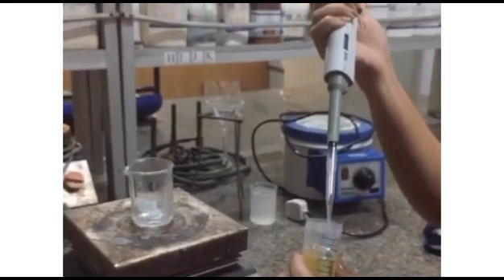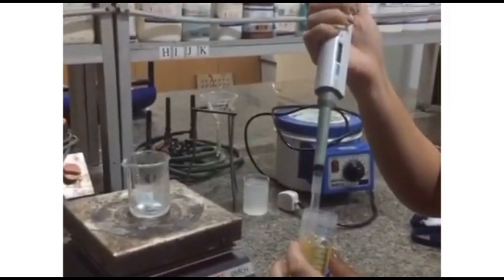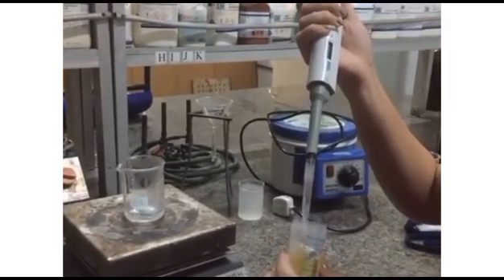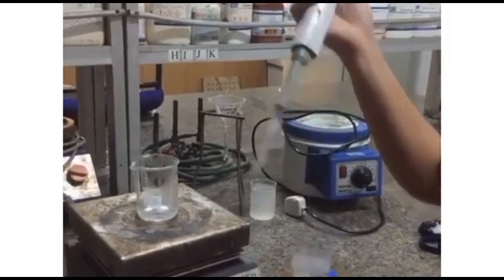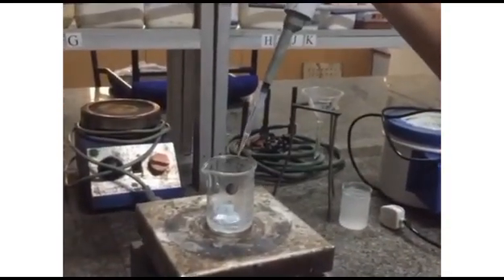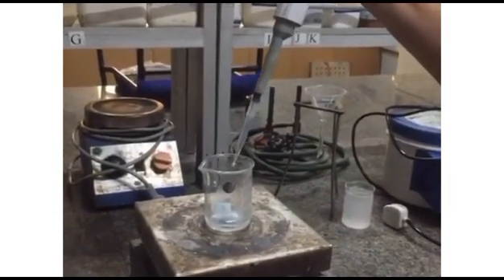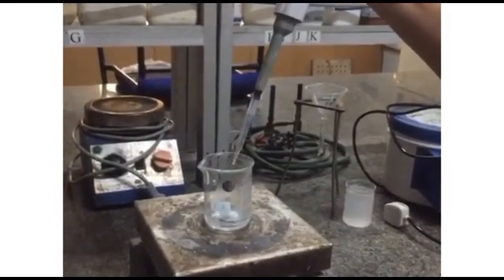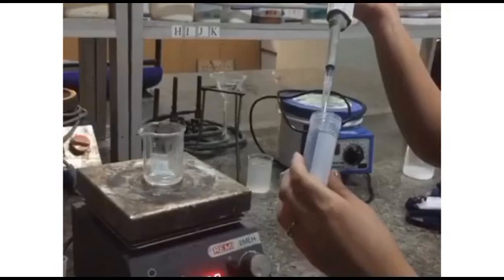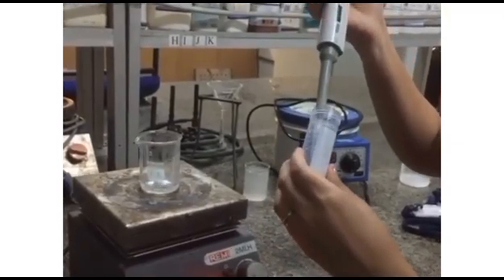To prepare the aqueous phase, in another beaker we took 10 ml of distilled water into which we added 3% Tween 80 and another surfactant, PEG400. This additional surfactant was added to increase the colloidal stability of the solid lipid nanoparticles.